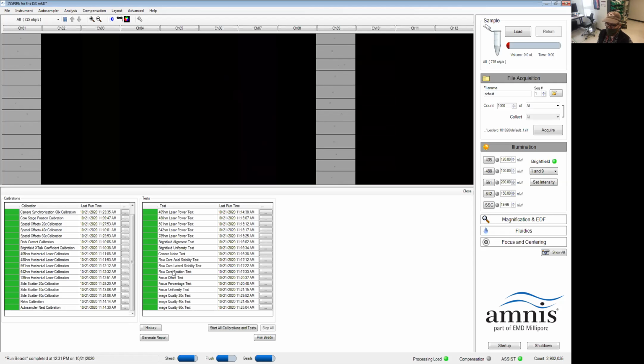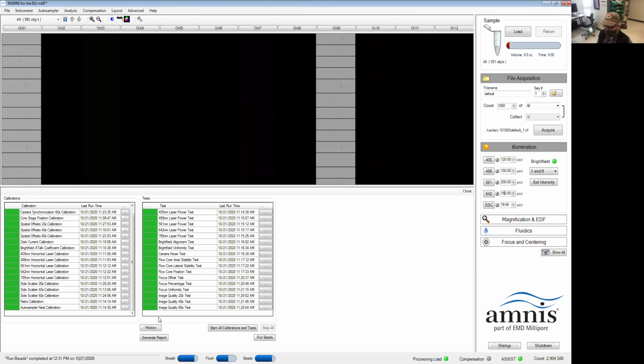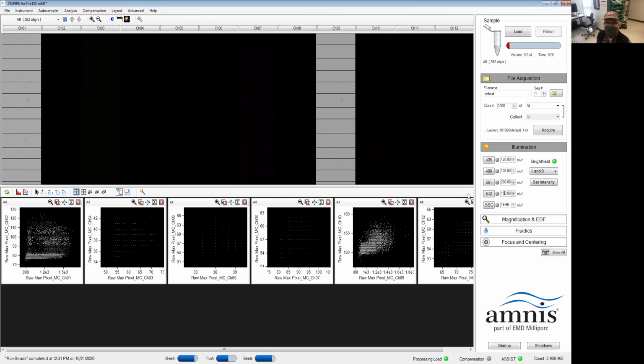We'll have a series of tests over here. This is the assist test. If you see a bunch of green bars across the board, it means everything is running smoothly, so you can jump in and start your experiment.